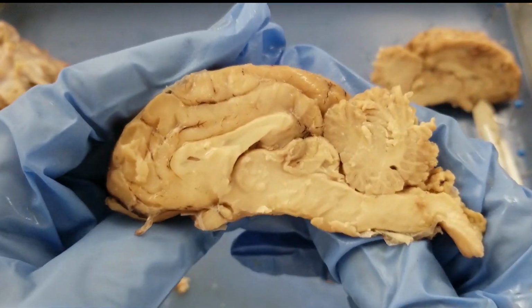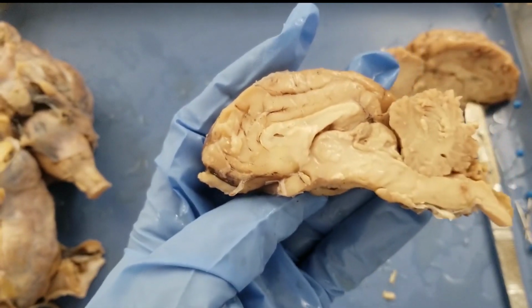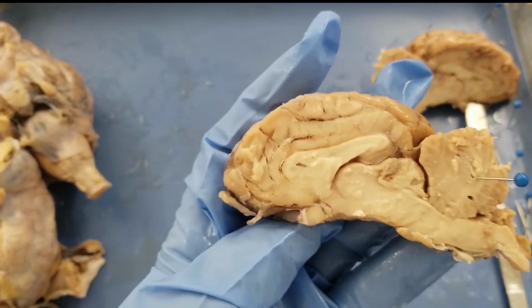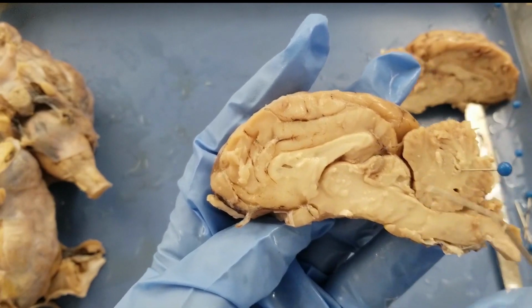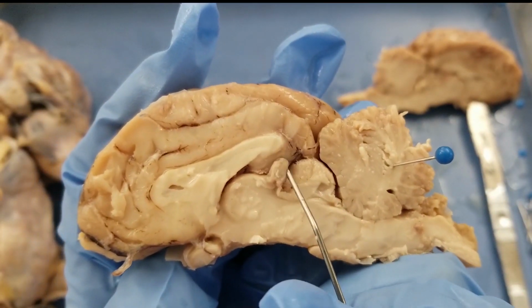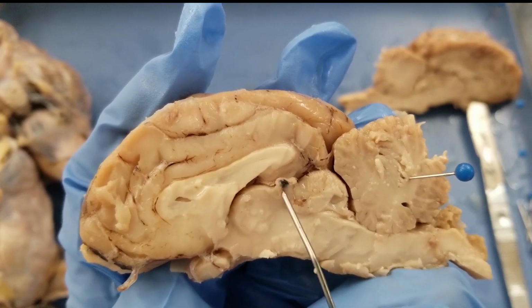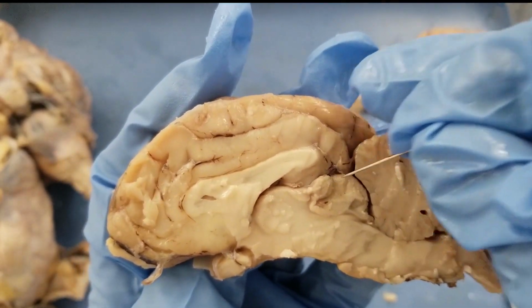Okay, on this half of the brain, we need to identify structures on the mid-sagittal plane. The first one is the cerebellum. That's easy, right? This big guy here is the cerebellum. Cerebellum is responsible for balance. And then the pineal gland. That is actually a very small piece of gland in here. You see here? It's connecting to the brain, but it's very small. It's an individual structure. This structure secretes melatonin and puts you to sleep.